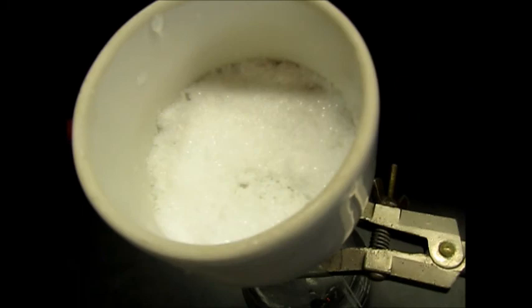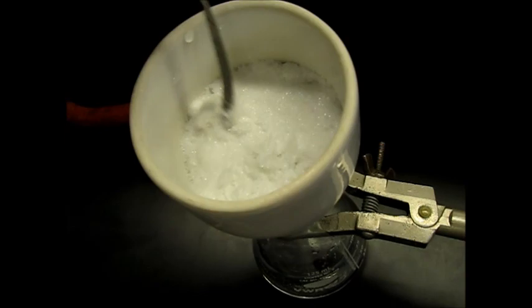And we'll pull through. So I'll just turn it on high vacuum. We'll leave it here to just kind of help air dry for about five or ten minutes. Looks like a nice white powdery substance. Good.